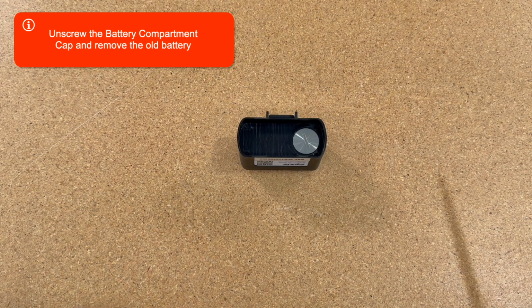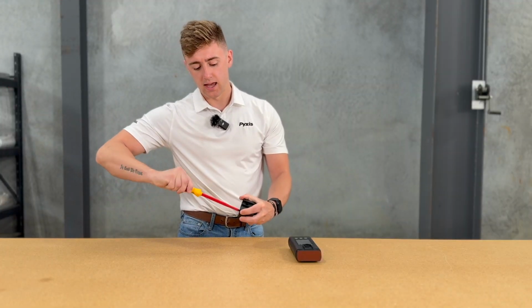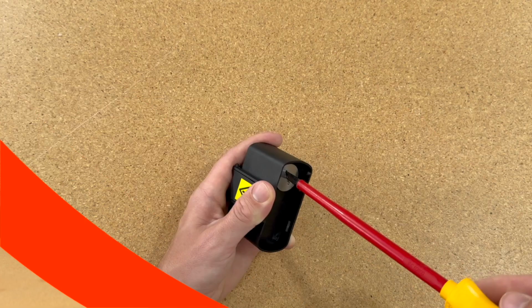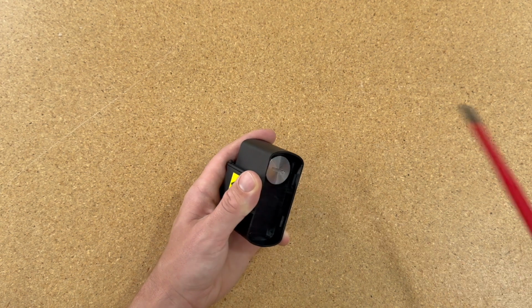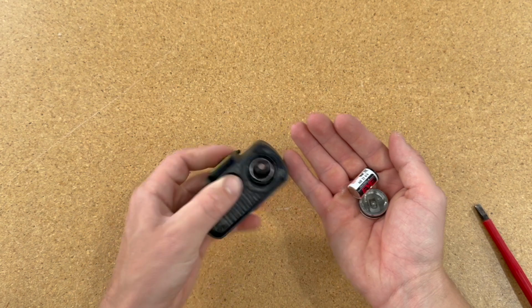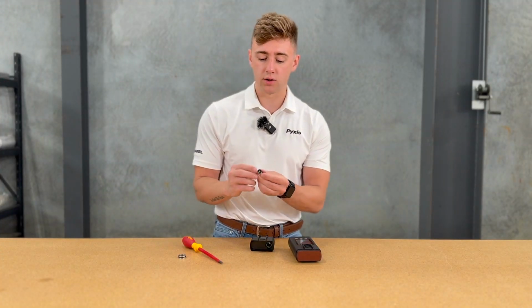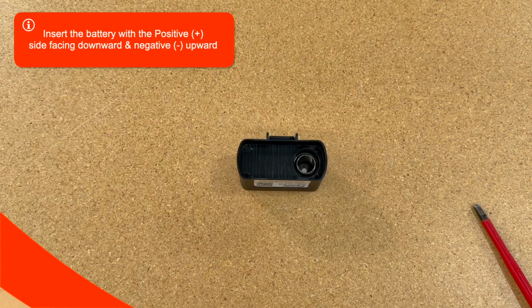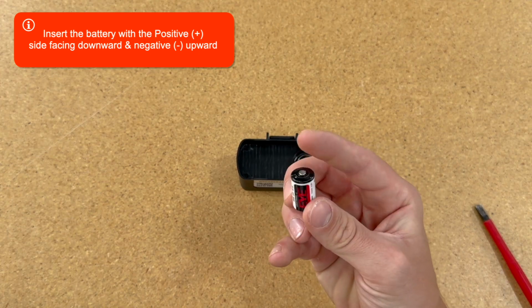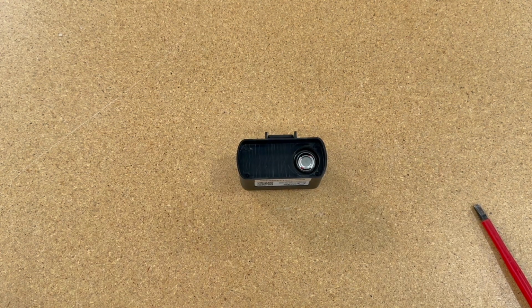I'm going to use a flathead screwdriver, and if we just insert it into this area and start to unthread, it'll quickly become easy to pop open the entire compartment head, and we'll be able to remove the old battery and insert a new one. For the new battery, we're going to want to make sure that the top end here with the little bump at the top, the positive end of the battery, goes into the compartment like so, and the flat end, the negative end of the battery, will be facing out toward us.